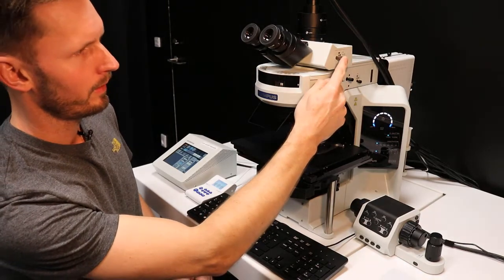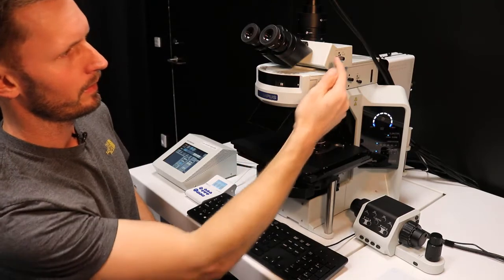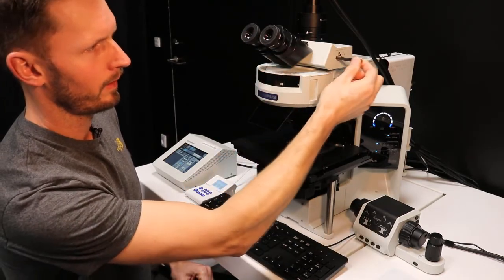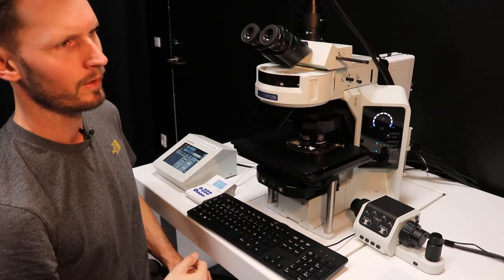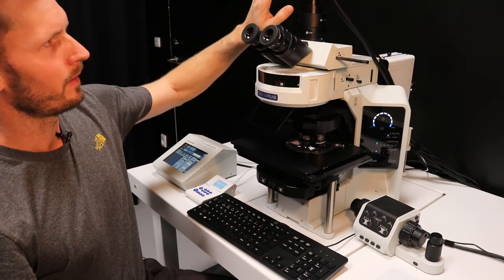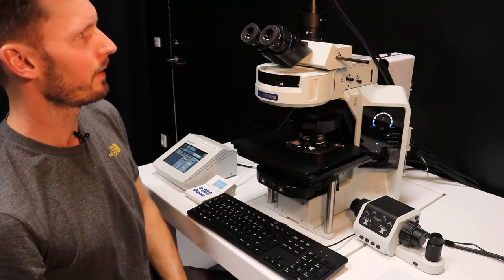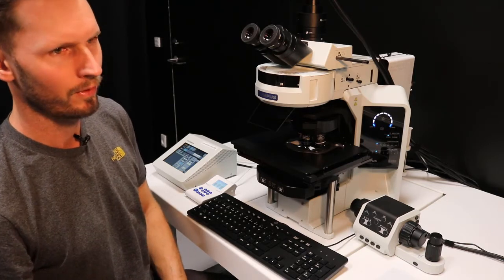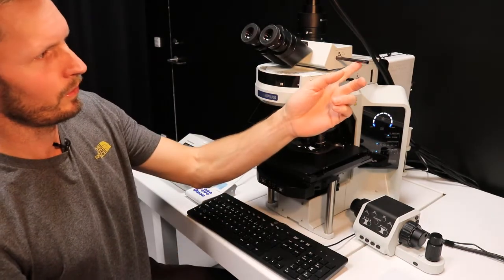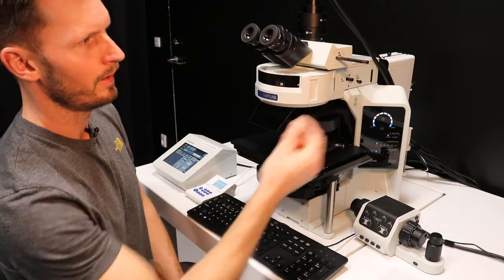When you operate the microscope manually, you will use the splitter up here fully in, meaning you have all the light to the oculars. When you take it all the way out, then you see everything with the microscope camera. And this is a sensitive, black and white camera with a quantum efficiency of approximately 60%. And you want to use all the light, so you want to take the splitter all the way out.